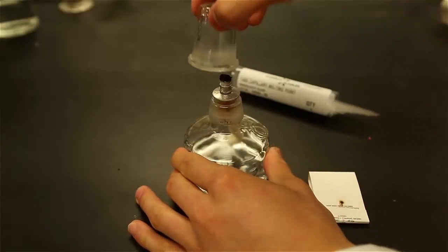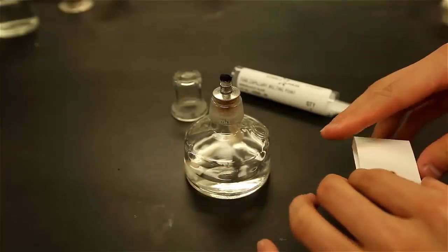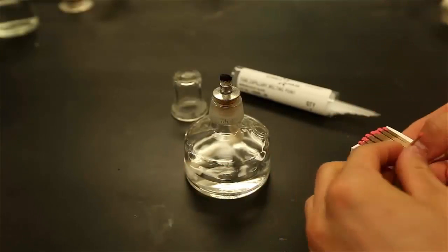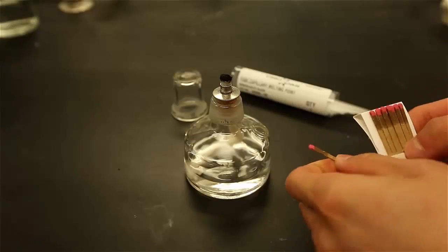To spot the plates, you will be utilizing microcapillaries, which you will prepare yourself. Start by carefully lighting a match, and then ignite the alcohol-saturated wick of the alcohol burner.